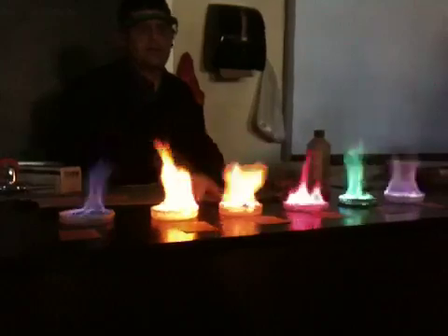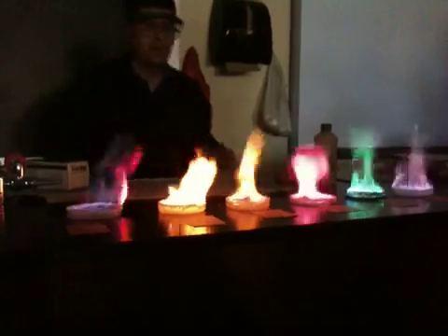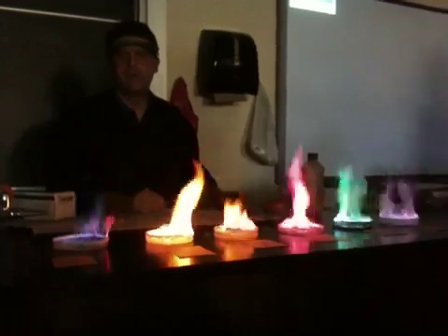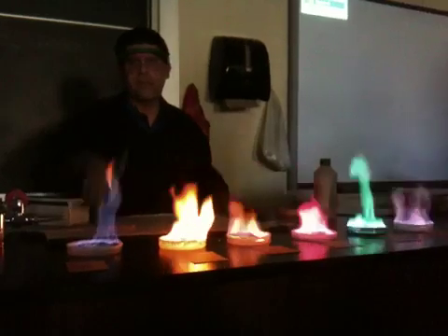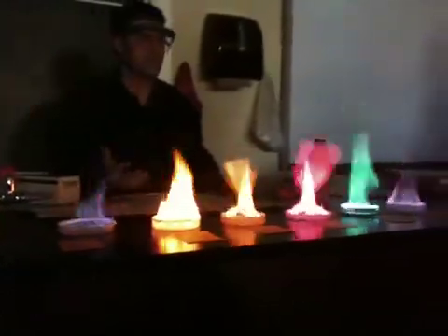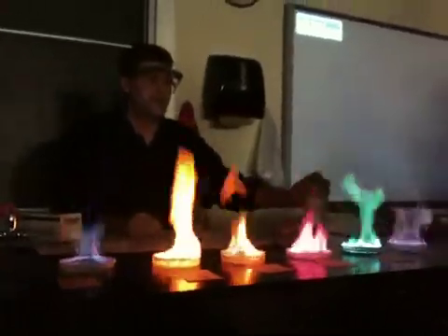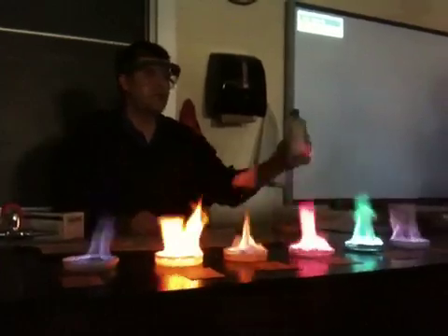All right, so what's the difference between the calcium and the sodium? This one's a little bit brighter. That one's not quite as bright of the yellow. That's so cool. Wait, so which one turned orange? The one in the fire. Calcium's supposed to be somewhere in orange, but it's hard to tell. This orange is red. Although the calcium — that's just alcohol burning off. The blue color that you see initially, this is methanol. So you're just seeing the alcohol burn off first.